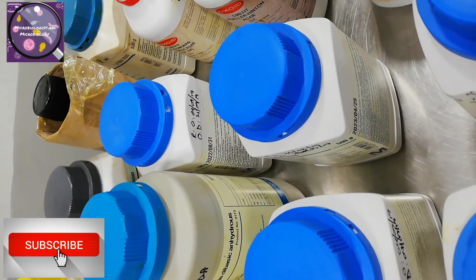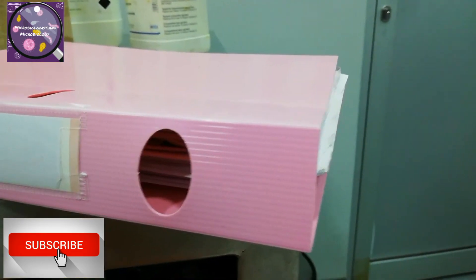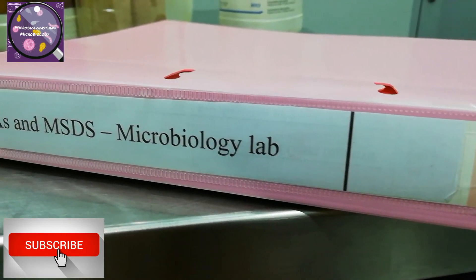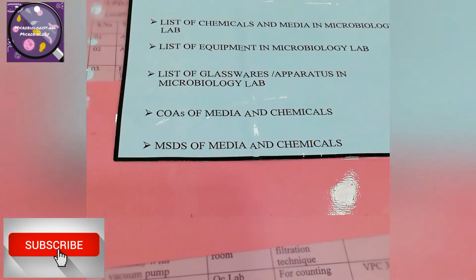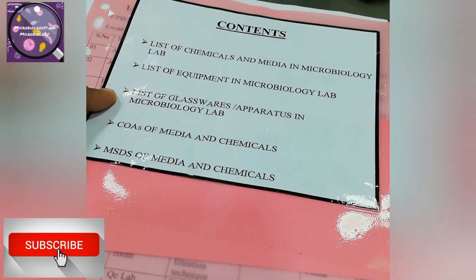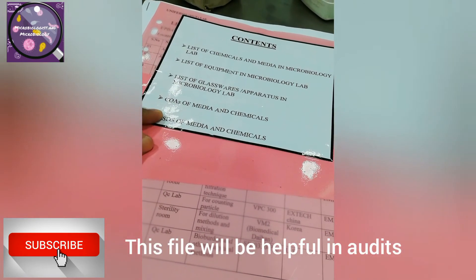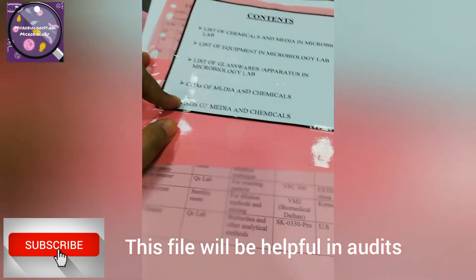Let me show you how we maintained our GLP file, because these things are helpful in different audits — either internal or external. We prepared this file as per ministry requirements. The contents include: list of chemicals and media in the micro lab, list of equipment, list of glassware and apparatus, COAs of media and chemicals, and MSDS of media and chemicals.